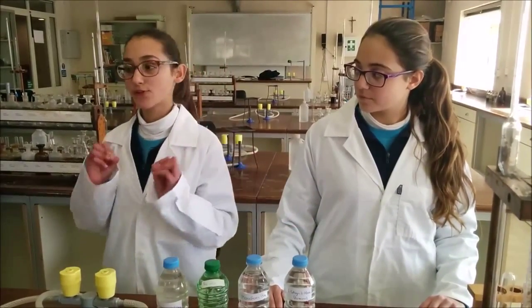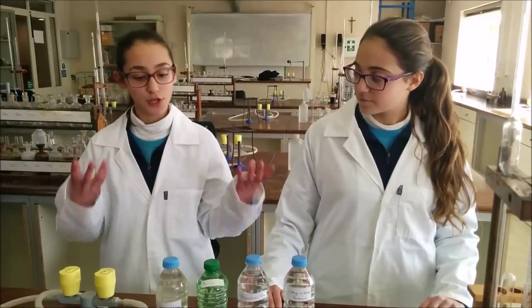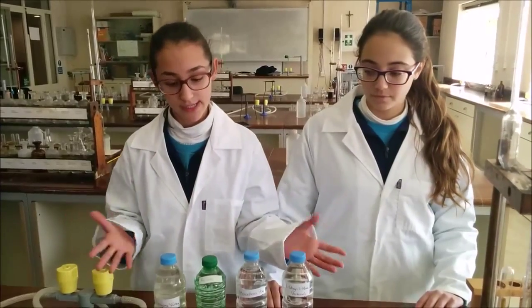Hello, I'm Laura and I'm Gabriella, and today we're going to do an investigation about the total dissolved solids in different water sources. Here are the samples of water. TDS stands for total dissolved solids, and it is the measurement to find the materials that are dissolved in water.